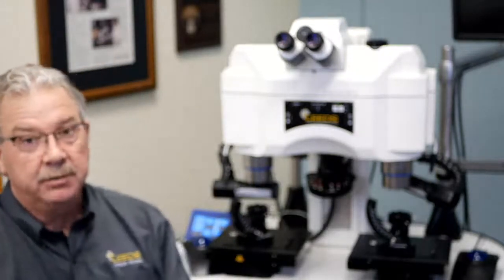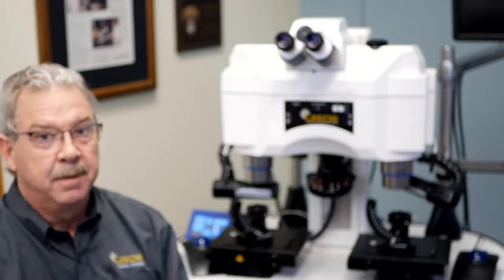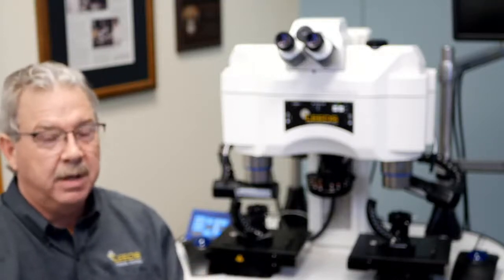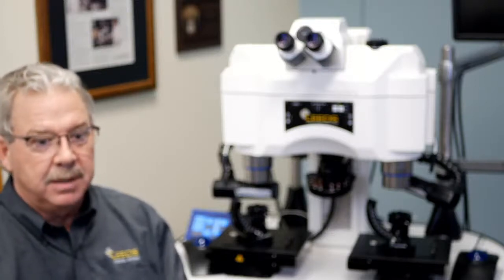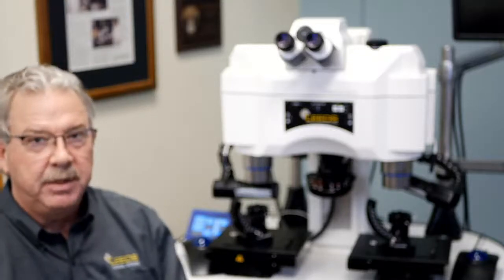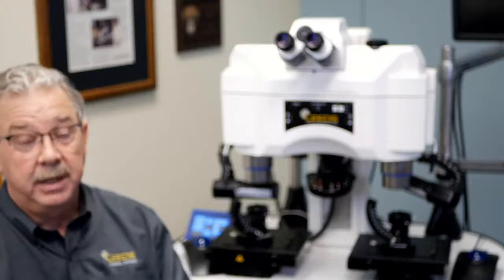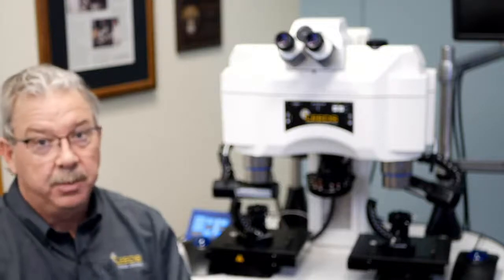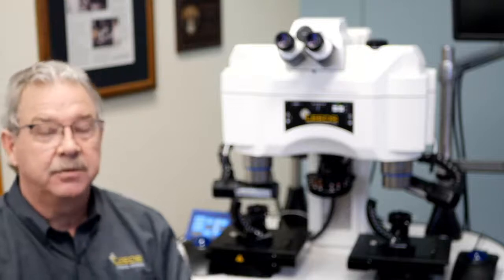So what we're going to talk about today is the field of view of your eyepieces. And as far as microscopy goes, this has always been one of the harder things for me to fully wrap my knowledge around. So when we look at an eyepiece, people would, I think, normally assume that if I'm looking at 10x, I see the same area on everybody's microscope at 10x. And the reality of that is that's not true.